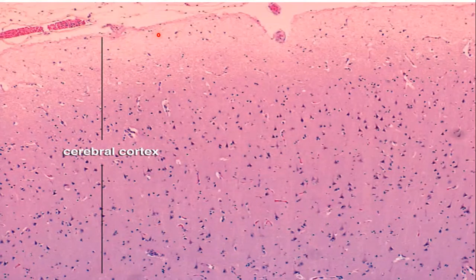This is also a diagram. This one is the pia mater, and this is the cerebral cortex. You can see these cells are the larger pyramidal cells, and these are the medium size pyramidal cells, and in the upper layer they contain the small size pyramidal cells. The dotted cell appearance is the granular cells.